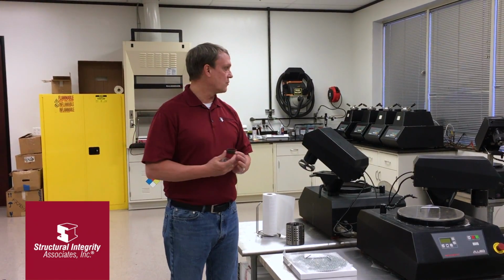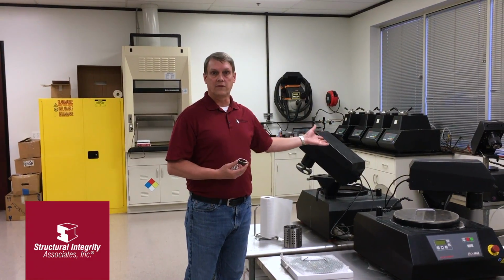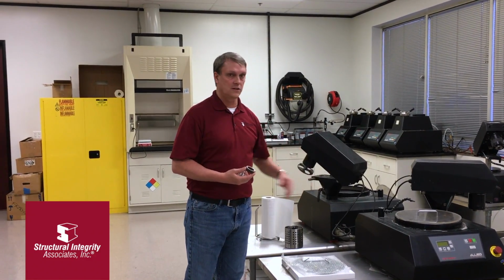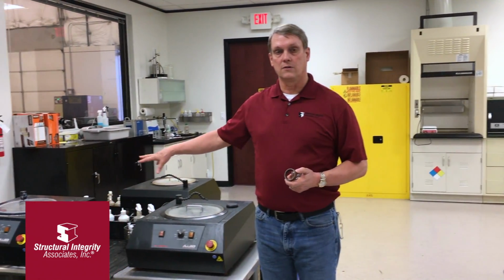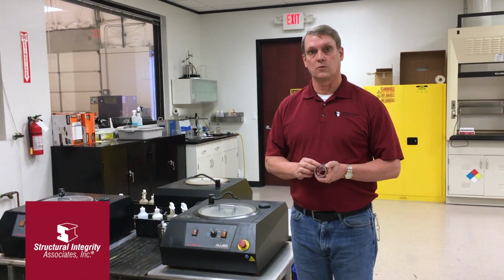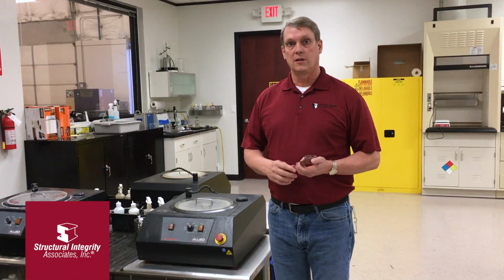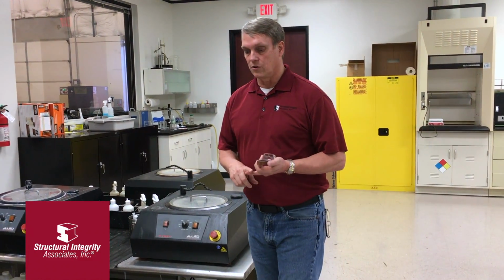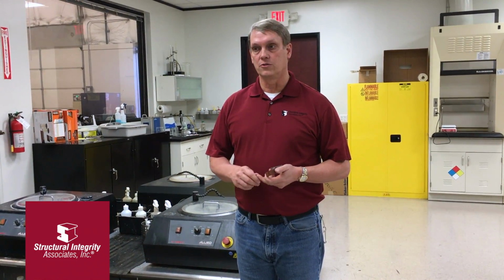So we go through a process of grinding, starting with very coarse sandpaper and going to a fine sandpaper on the polishing wheels here. The final polishing steps are done on this side, and with these machines we take the surface finish down to a mirror finish, so that when we etch the samples using an appropriate acid, it brings out the microstructure, including grain size, fracture or crack morphology, inclusions, or other things in the sample that we might need to see. And all of this information feeds into the overall failure analysis process.